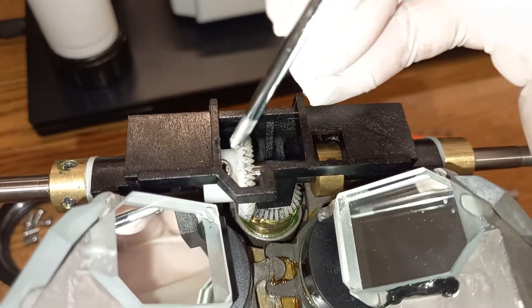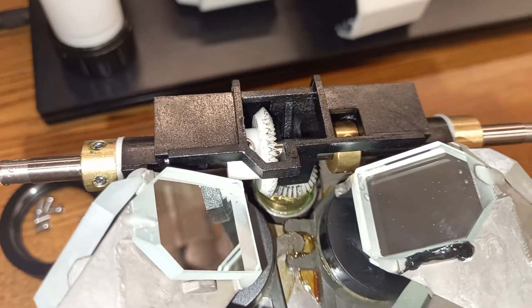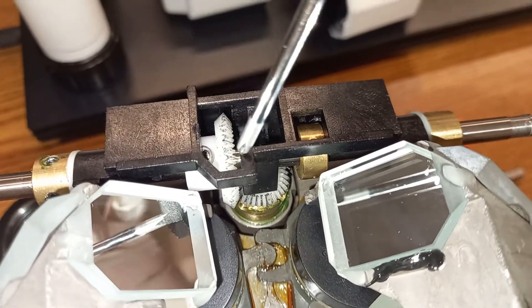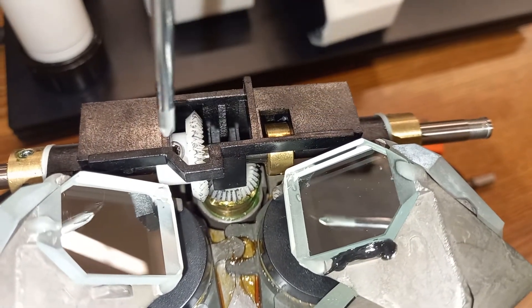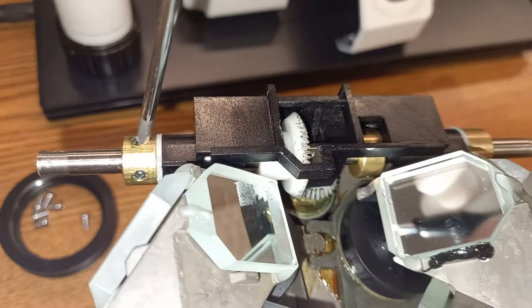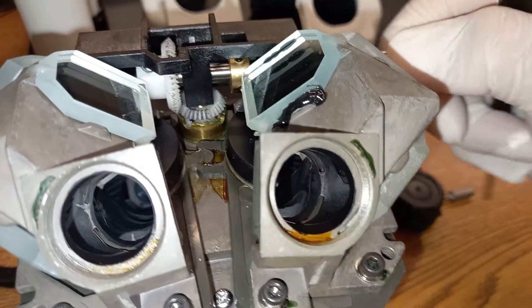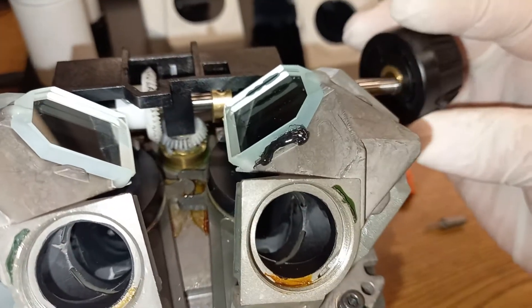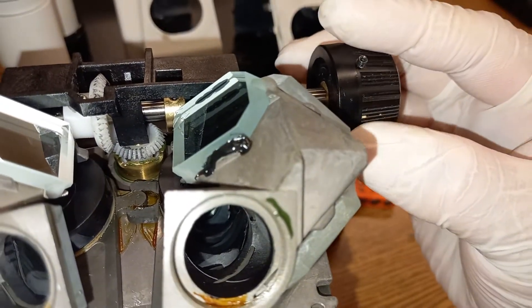These gears were slipping and grinding. As a result, I couldn't get this shaft to turn because of how loose this gear was. A simple solution was to loosen these couplings — they were sort of loose, so I had to readjust them. And also this beveled gear mechanism has a screw there, so I slid it over on the metal shaft, adjusted it to the right position, tightened it, and tightened the couplings on both sides. Now everything is a lot smoother — it's supposed to be smooth with no clicking mechanism whatsoever. The only way you can turn it is to place this knob on here, tighten these hex screws, and voila!